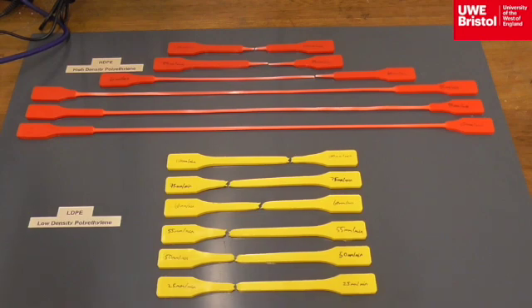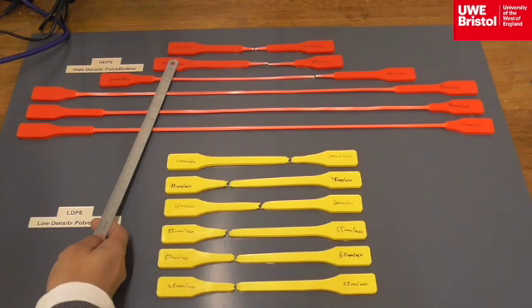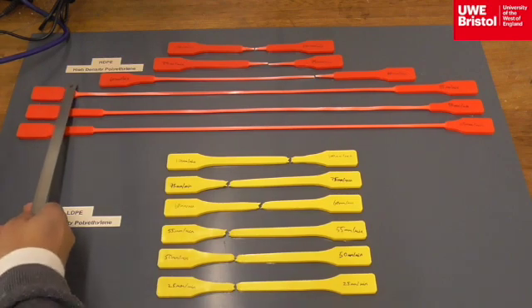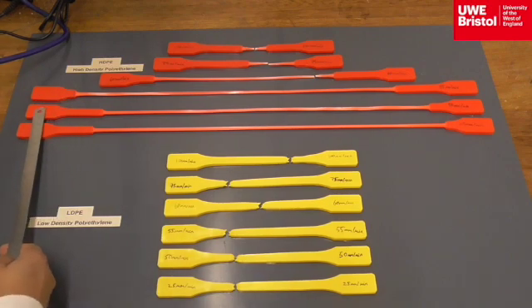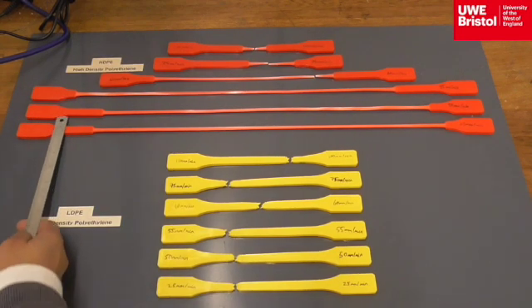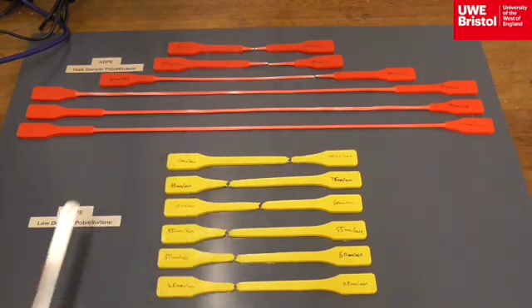fracture. However, in the case of high-density polyethylene, this is very rate dependent on its properties of ductility and how it behaves. At the three lowest rates of extension, 25 mm, 50 mm, and 55 mm per minute, the high-density polyethylene did not fracture. In fact, it reached the top of the Instron universal testing machine and it remained intact. If the machine was taller, it would eventually fracture, even at these low rates of extension.